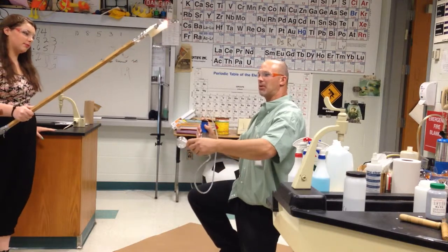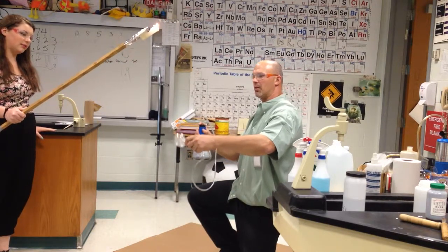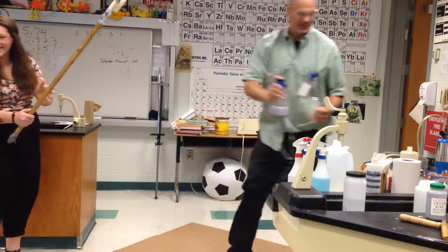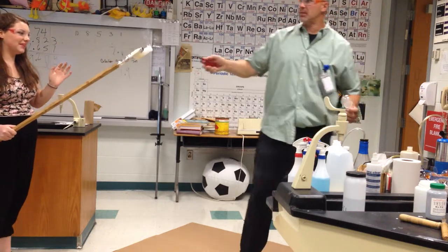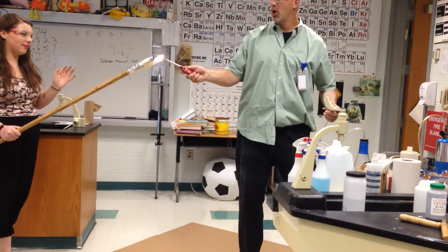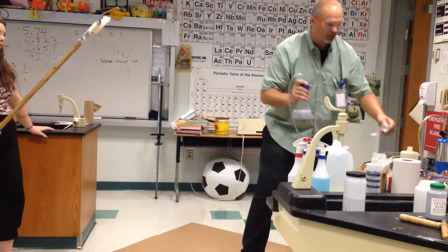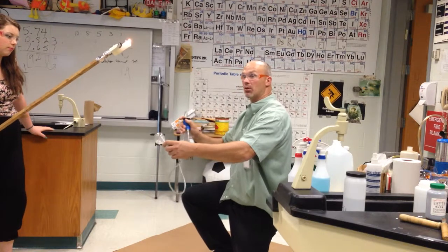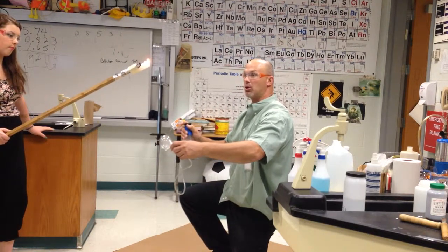Did that go up or down? So it's lighter than air. Now the question is: did it explode the same way? No, it did not. How did it burn — faster or slower? Faster. Do you want to cook with this? No, because you'll be cooked with it.